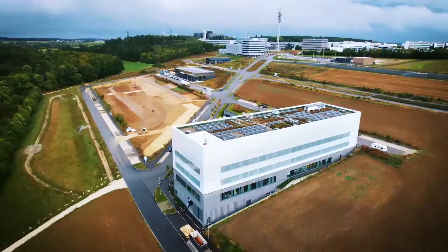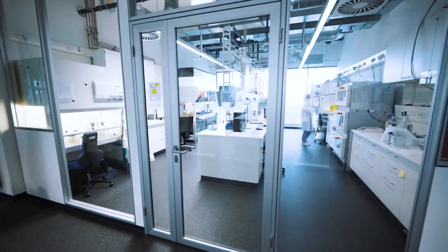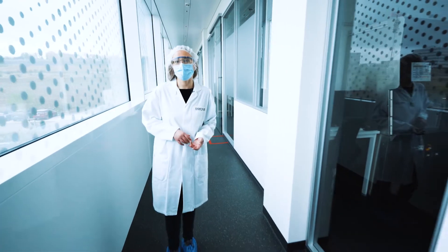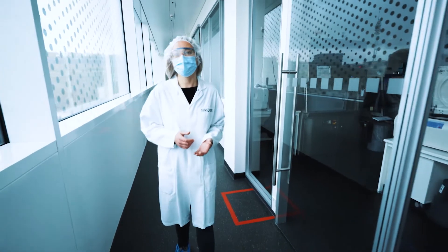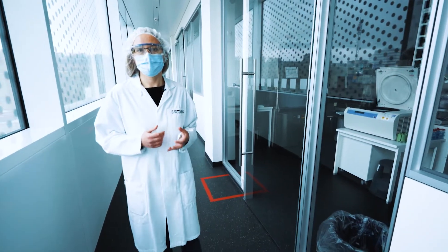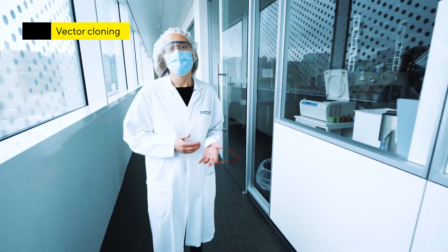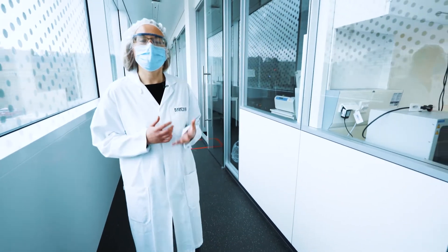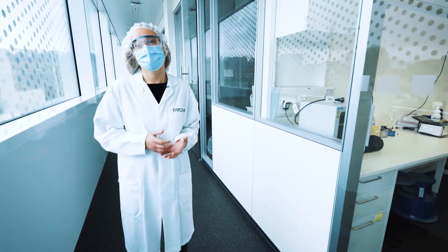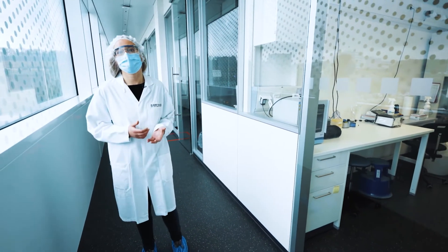Let's now walk through our CHO CLD process directly from our labs. Here we are in our operations lab on the second floor where the CLD process actually starts. After synthesis of the genes of interest, vector cloning takes place. We use our own expression vector which has been optimized for stable integration, high expression, and efficient secretion of the target protein.